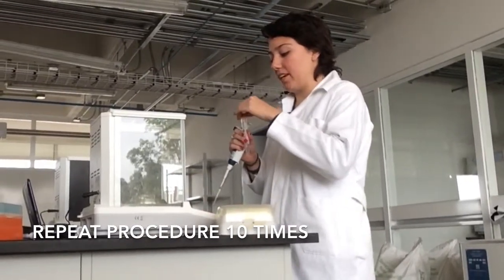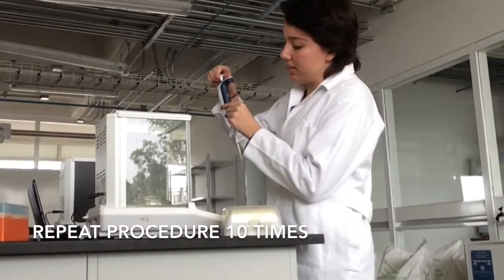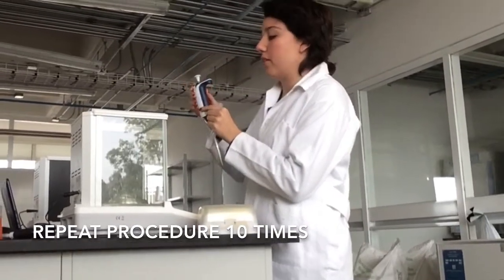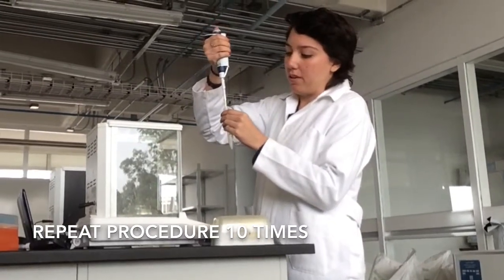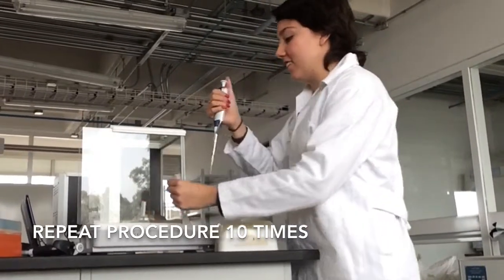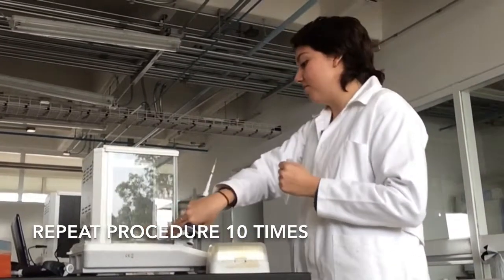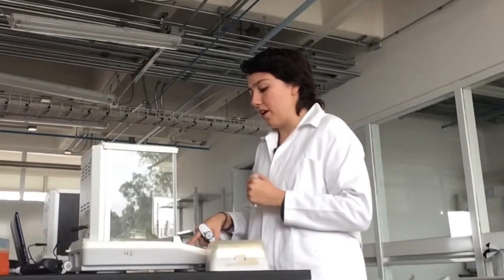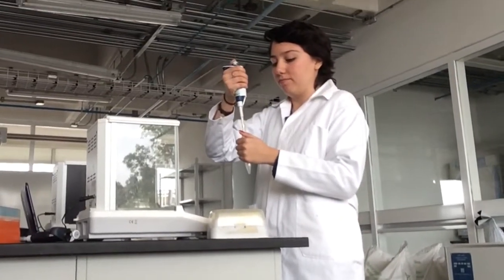And then we have to be sure that it has here 20 microliters. So we take the sample of water, and then we put it in the compartment, and we take note of the result we have, and then we put again the scale to 0, and we do it again.